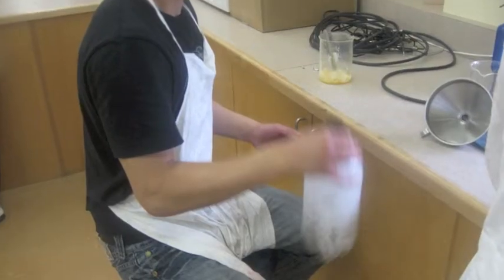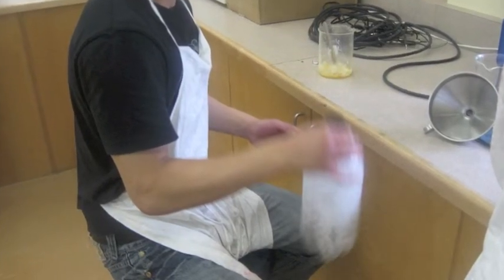After the 10 minutes is complete, shake the bottle vigorously again for 20 to 30 seconds and let it settle over a period of about 2 weeks.